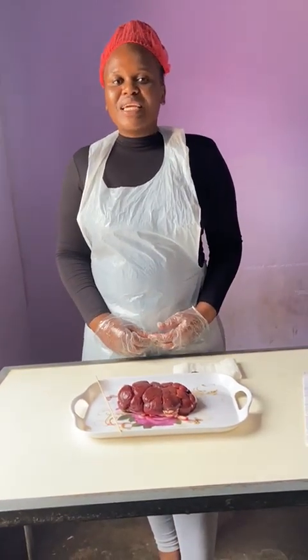Good day, my name is Nsobotiwa, and today I will be dissecting a cow kidney. A cow kidney is a lobulated organ, meaning it is made of several lobes, each lobe containing the structures of the urinary system. I will focus on one lobe to dissect, identify and explain their function.